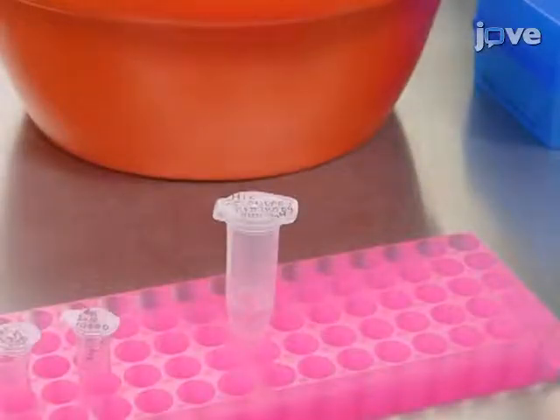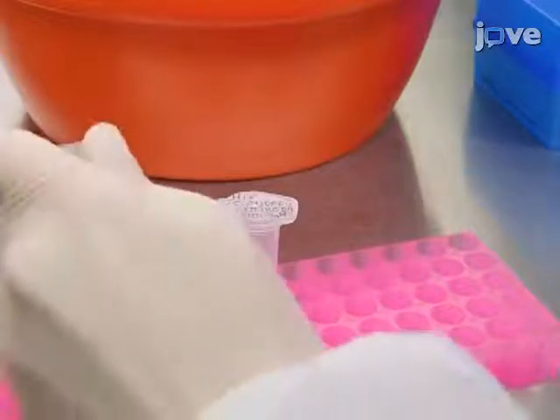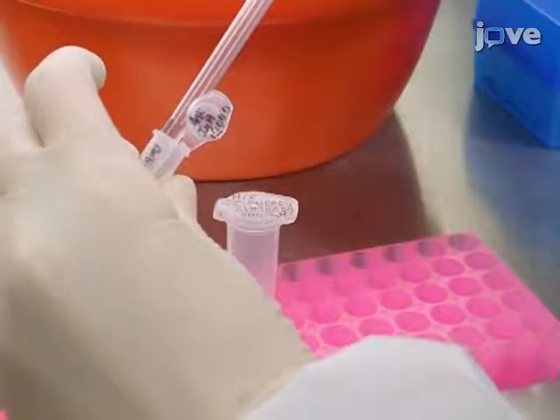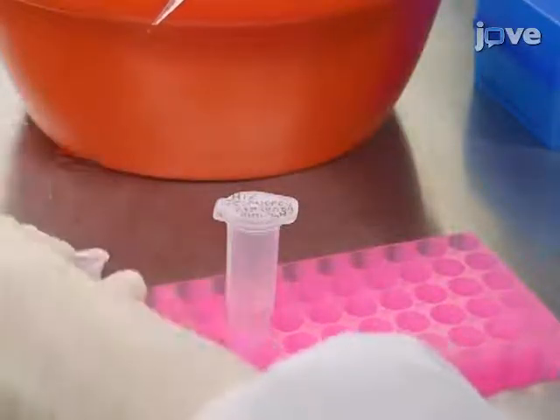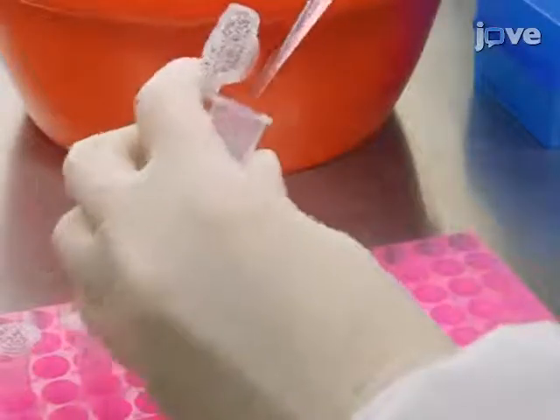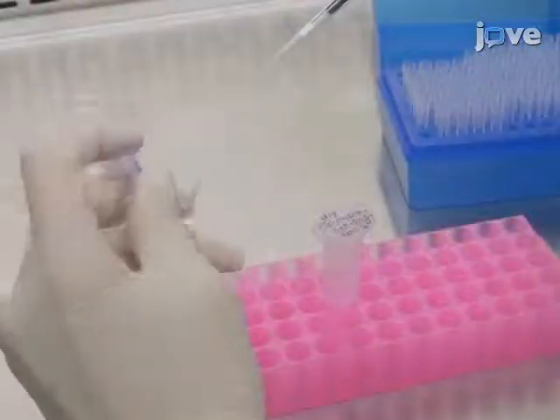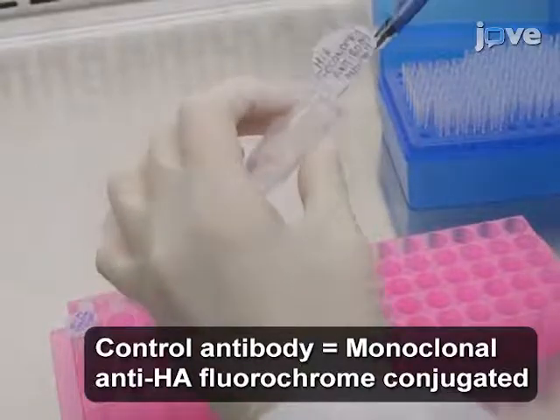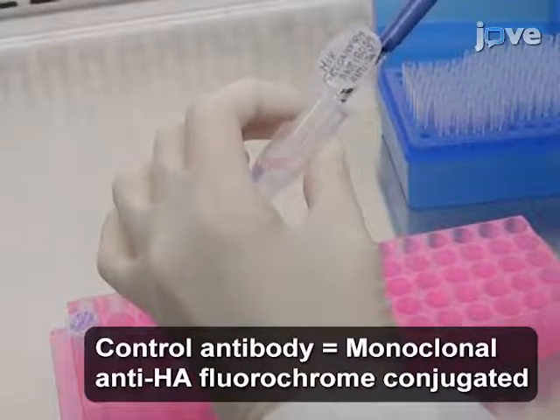Dilute the secondary antibody in the staining buffer. Use anti-human IgM fluorochrome conjugated antibody or anti-human IgG fluorochrome conjugated antibody at a dilution of 1 to 5000 in staining buffer. Then, mix the control-labeled antibody at a dilution of 1 to 1000 in staining buffer with the diluted secondary antibody.